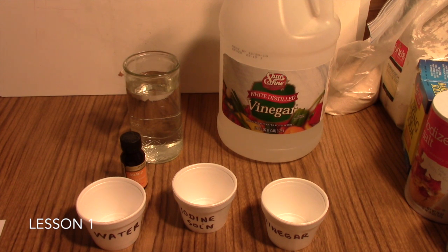This is the Unknown Powders Identification Lab, which goes with Lesson 1 in your Friendly Chemistry course. In this lab, your students will practice making a series of observations on several unknown powders that you will provide for them. They'll record their data on data sheets, and then at the end of the lab, you'll have time to discuss and make hypotheses as to what they think the identity of these powders are. Let's take a look first at the data sheet which you will use to conduct this lab.